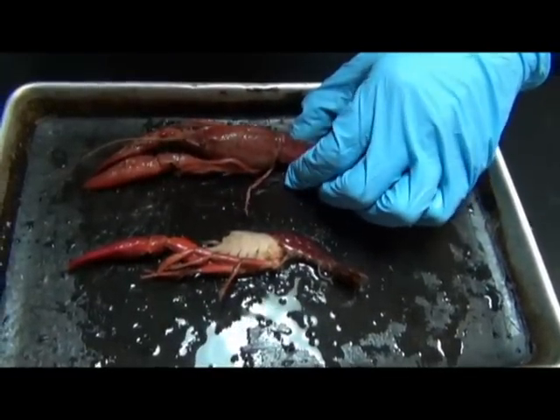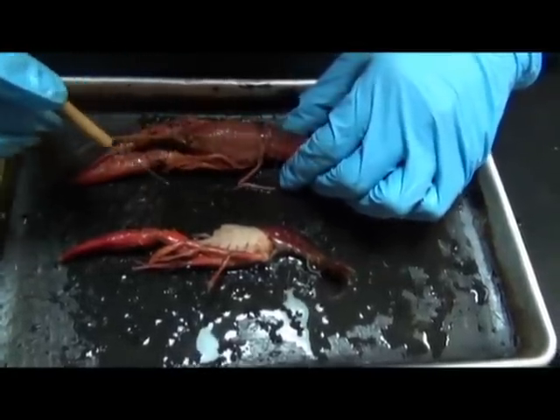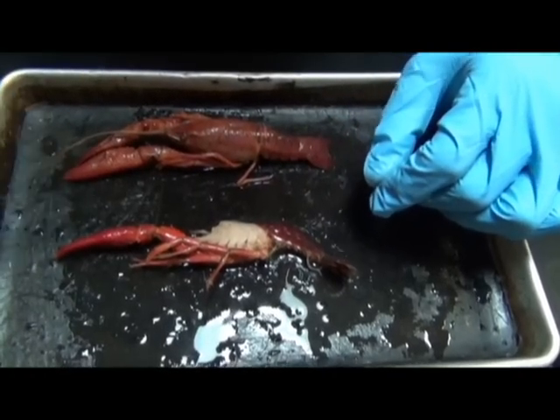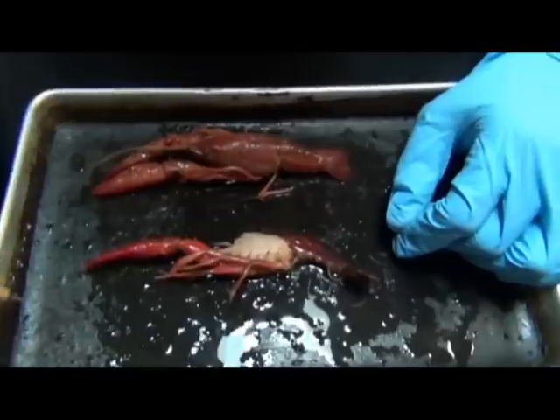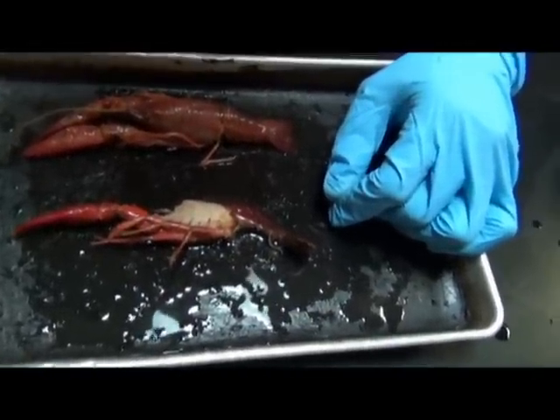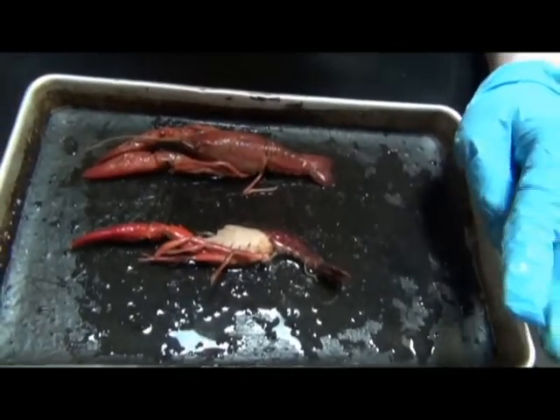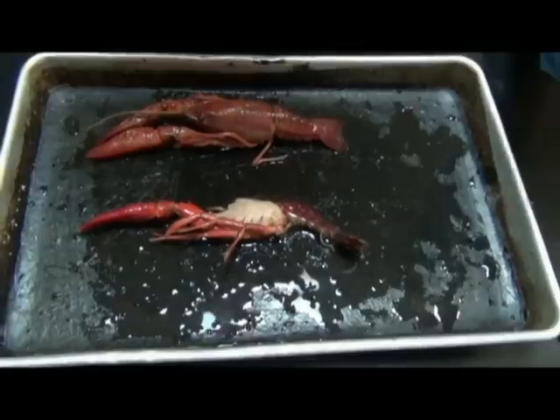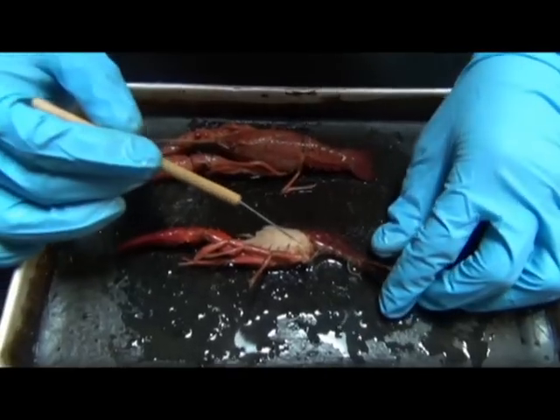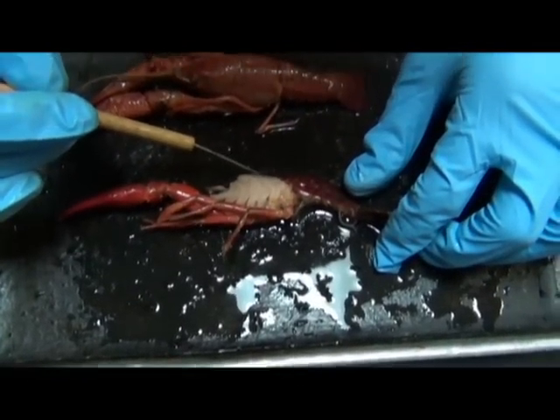One of the synapomorphies, one of the shared derived characteristics of this group, is that they have what are called biramous appendages. Now, biramous means, well, let's break the word down. Bi means two, ramus means associated with branching. And so in the crustaceans, you have appendages that often have two branches coming out of a single base. And what I just mentioned about the walking leg exemplifies this. You have one base, one appendage is a walking leg, the other appendage is a gill.